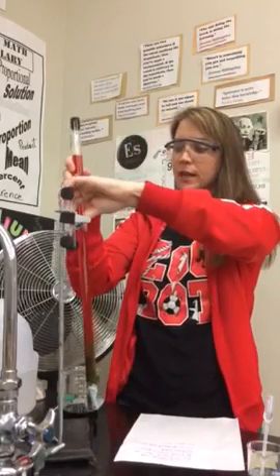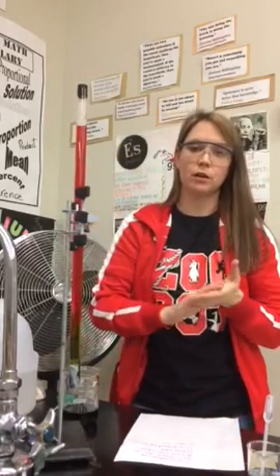And the last question was predict what color we would get when the acid and the base mix together, and we should have predicted a green color.